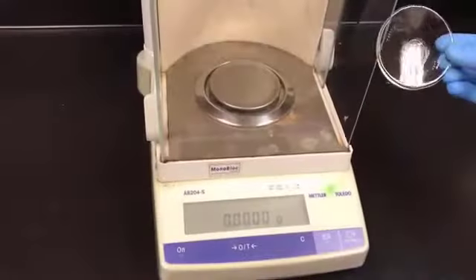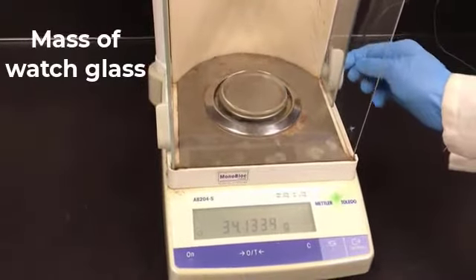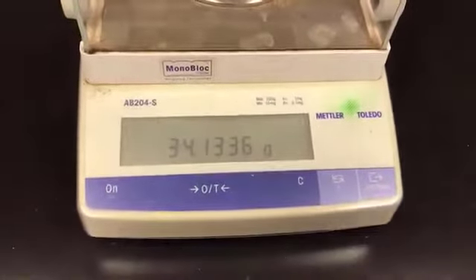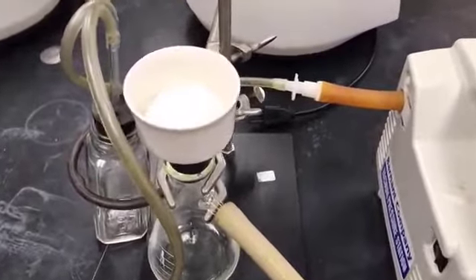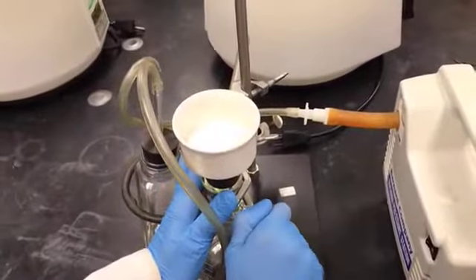I'm going to take the mass of the watch glass because I'm going to transfer my crystals of sulfanilamide onto it. So the watch glass has to be pre-weighed. So this is the mass. It's already been 15 minutes since the crystals have been drying, and it's time to turn off the vacuum pump. And I'm going to slowly remove the vacuum.